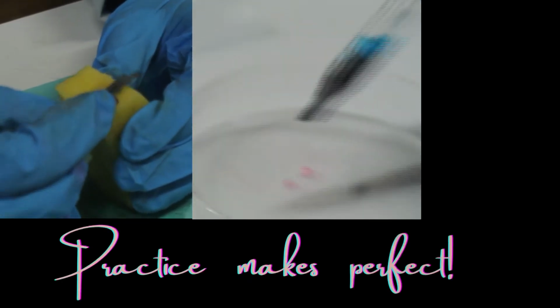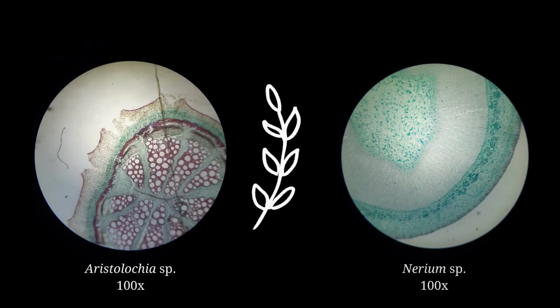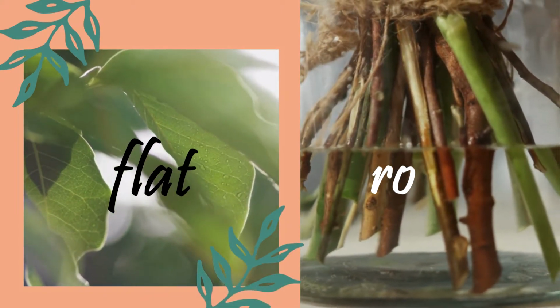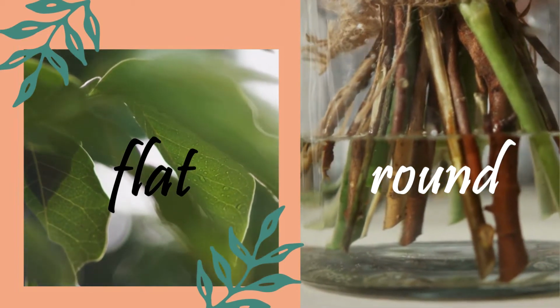Here, practice makes perfect, and that means having 1 cell thick sections. Before we jump into the procedure, we must first categorize our plant part of choice as flat or round. This will help us determine the technique we will use in sectioning them.